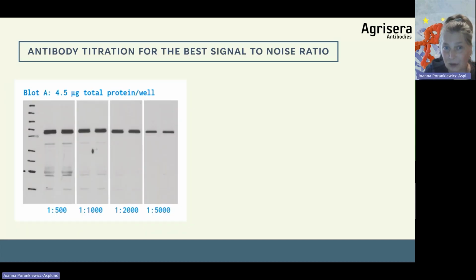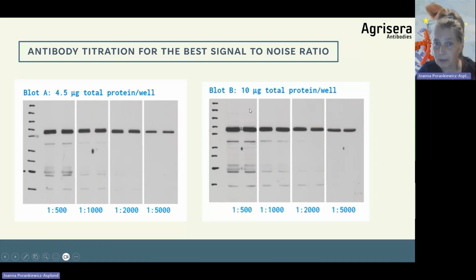I mentioned best signal-to-noise ratio and how it is connected to the background. As you see here, in this example, the protein load was 4.5 microgram of total protein per well, and the primary antibody was quite concentrated. So, of course, the background bands were coming up. Diluting primary antibody is, of course, diluting also the background. And in this example, with a higher protein load, we will have more background coming up. This kind of optimization can be done once you know how your protein-antibody pair is performing. So this is like refining the results and doing that titration.